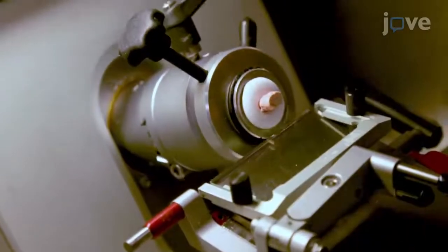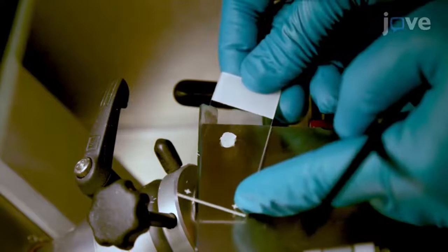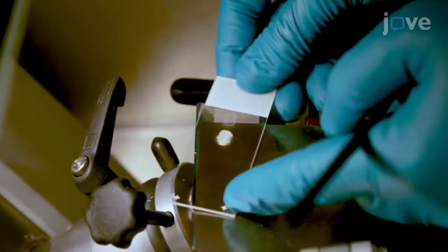Cut the tissue with the guidance of a stereotaxic atlas in sections of desired thickness, and unfold the section with a small brush if necessary. Thaw mount the section onto a microscope slide.